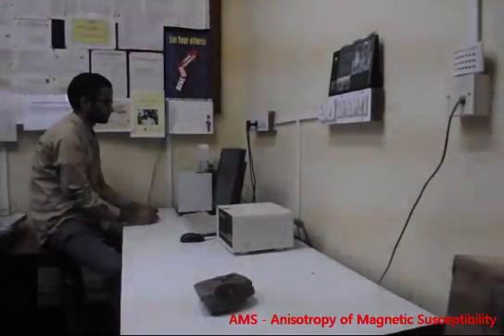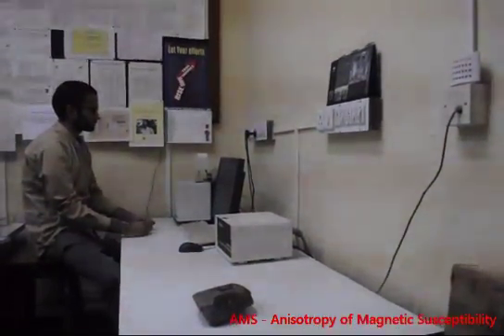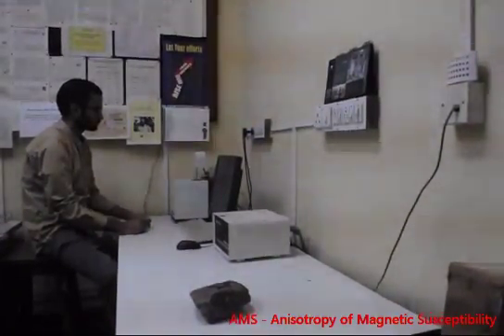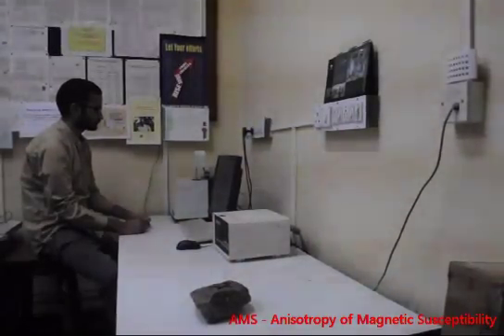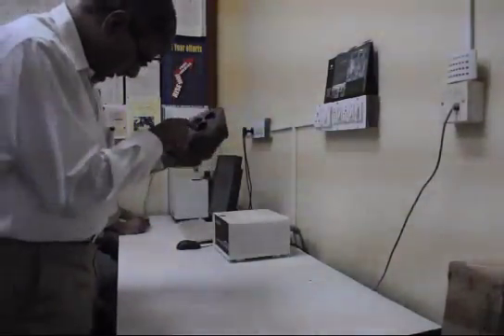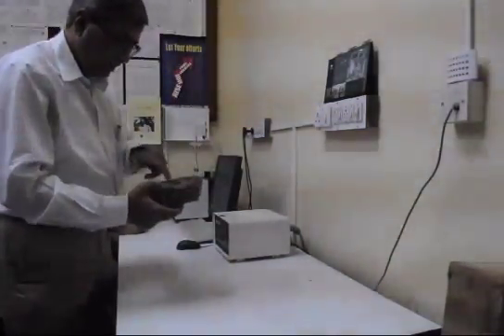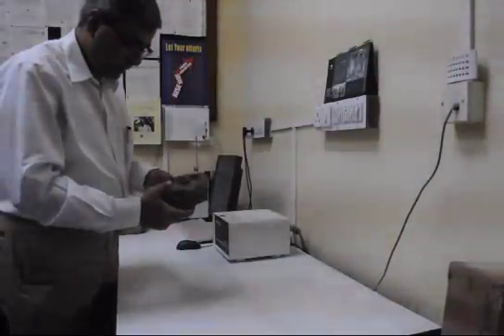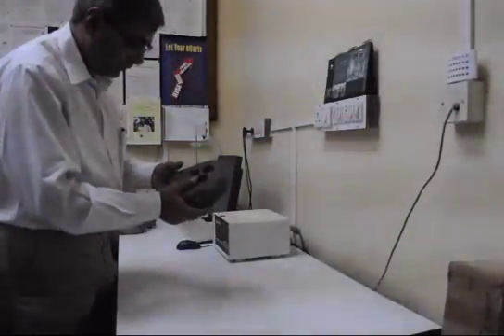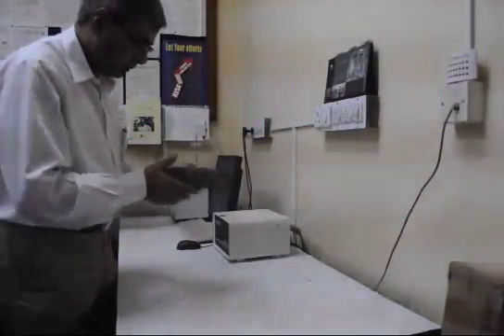Here we analyze cylindrical cores obtained by drilling oriented samples collected in the field. We have a drilling machine in our drilling unit. Cylindrical cores are extracted from oriented samples — each core is 25.4 millimeters in diameter and 22 millimeters in height, and we drill multiple cores from each sample.